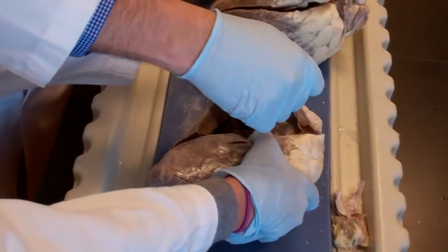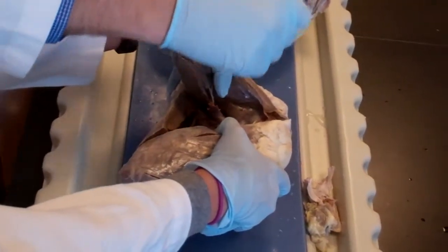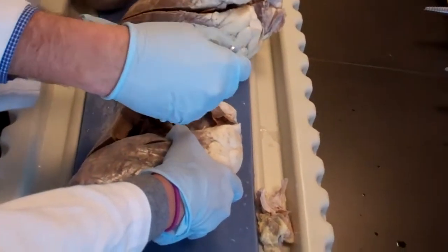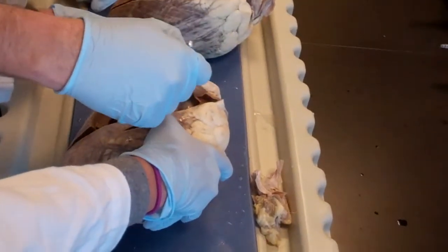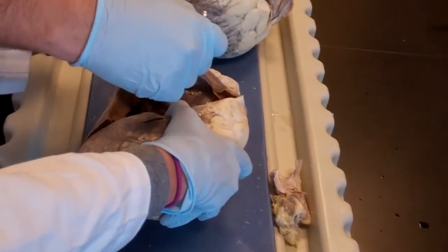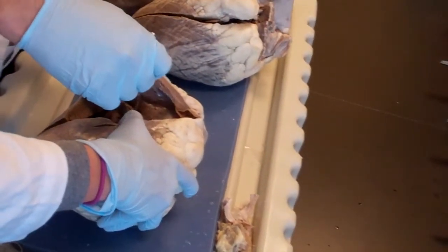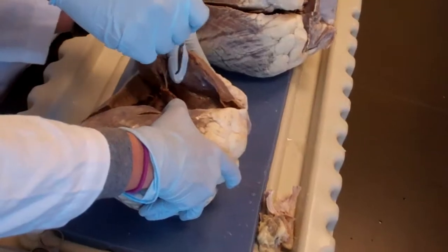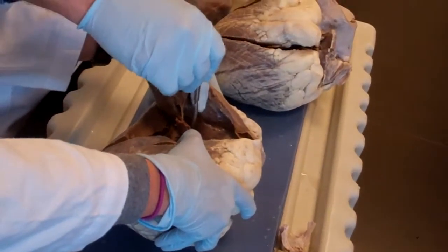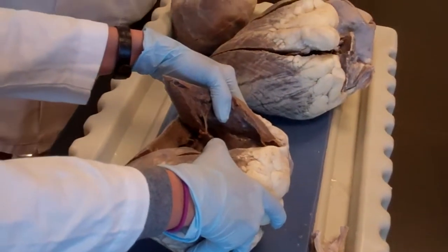Now you've seen this. This was attached here to this, and Elizabeth cut it off when she pulled very hard. All right. I have to blame somebody. And this is the one and only moderator band. Technically, it is a branch of the conduction system of the heart. Okay, and it goes to the right side, and it connects the wall, the interventricular septum, to the wall of the right ventricle. Come closer.